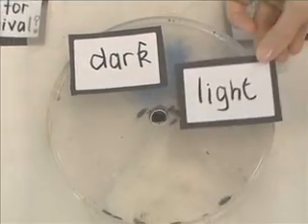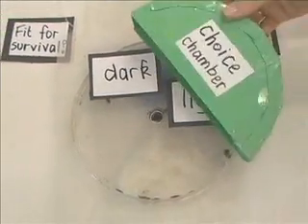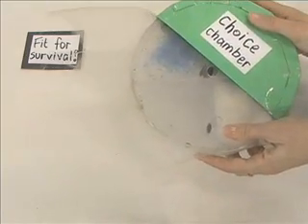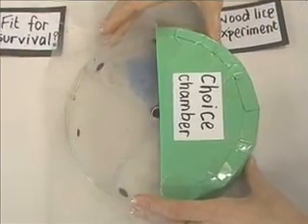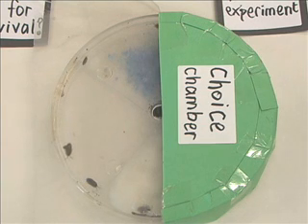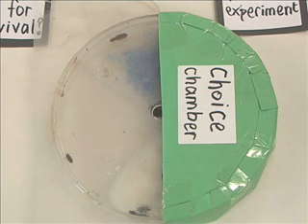Now it's not just dry and moist we can do — we can also let them choose between dark and light. What we do then is we actually cover part of the choice chamber with a special cover. Then we do that again: we give them a chance to look around and explore the different areas, and then every minute for five minutes, once they've had a chance to get used to the conditions, we count how many are in each of our areas.